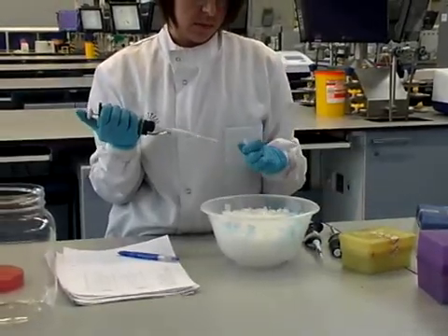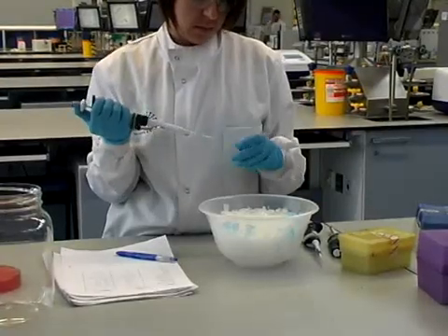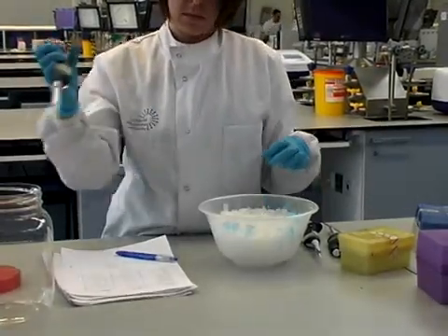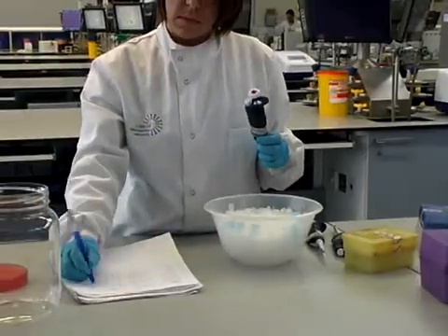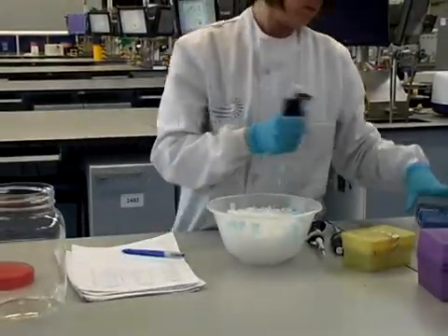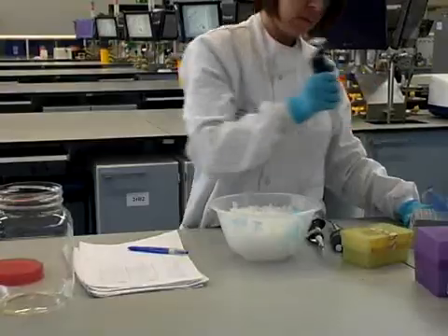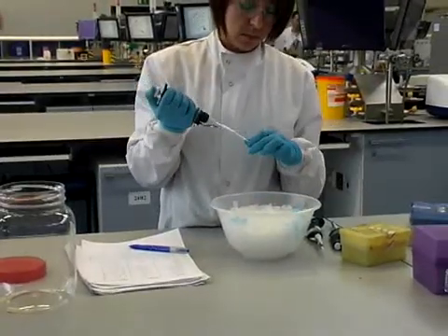The next reagent is the forward primer. The primer is a piece of DNA which corresponds to the piece of DNA that you're actually looking for. And the next reagent is the reverse primer. This is added to your master mix.